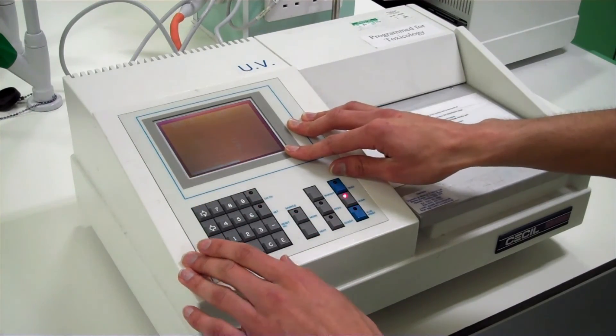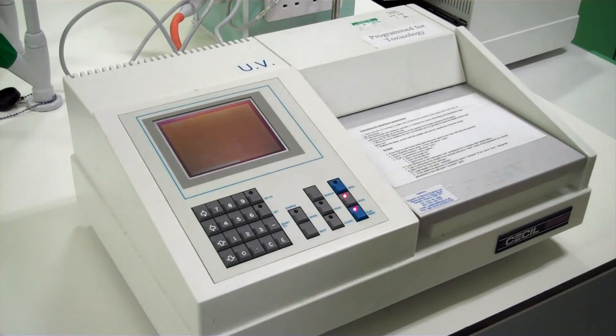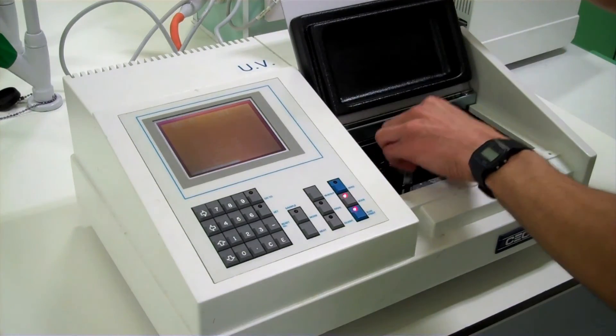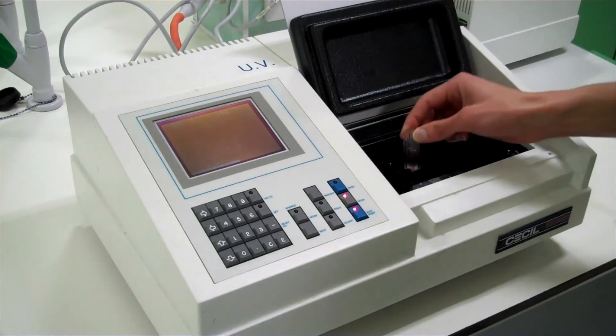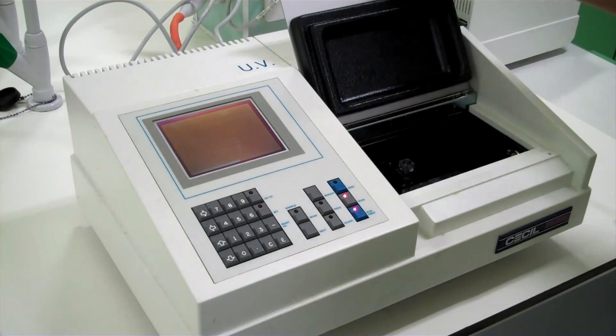Any absorbances outside this range will not be shown in our absorbance spectrum. Now we can load our sample and press run. When it has finished you can press run again to print out a copy of the absorbance spectrum.